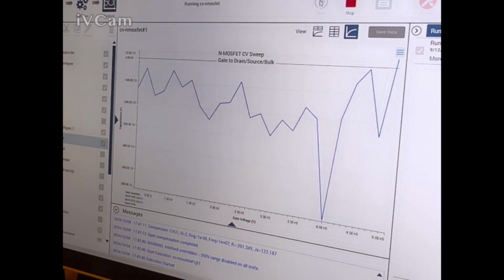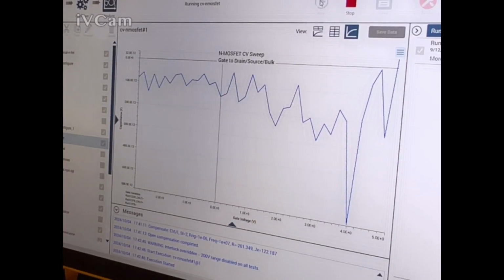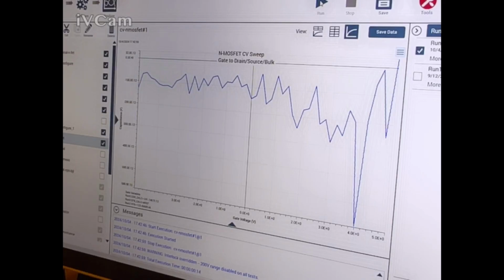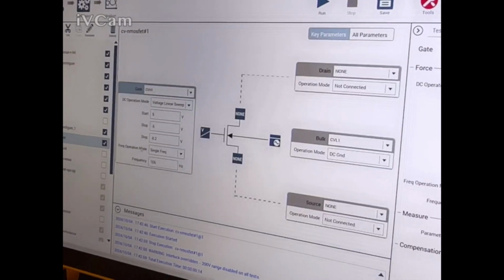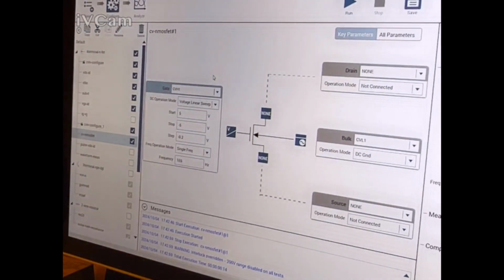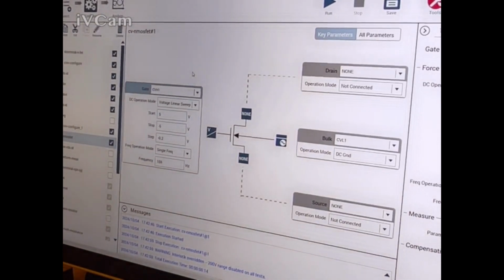So what are the settings used for this? It was just the default. Something doesn't look right though. Something's not right here. Let's go back. We got CV high. Oh, we got CV high on the gate. CV high on the gate. CV high is which one?